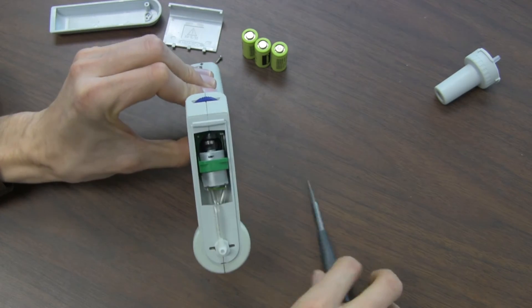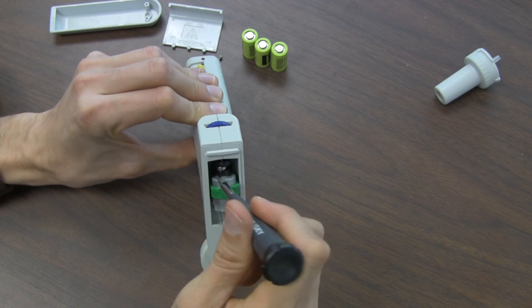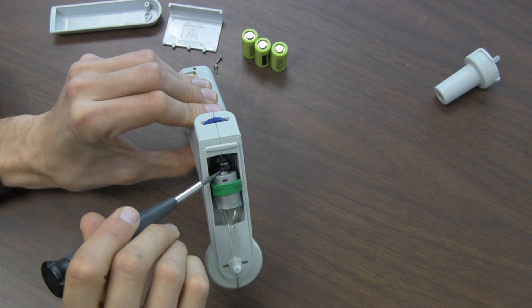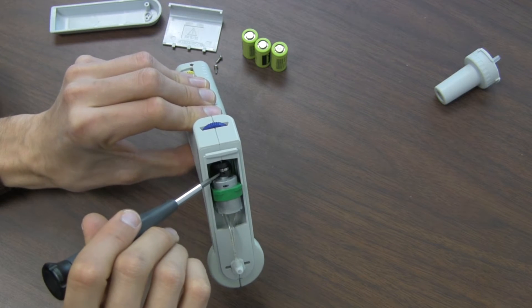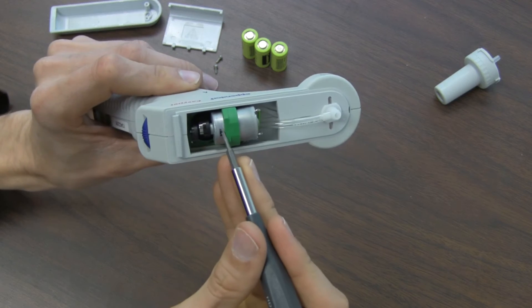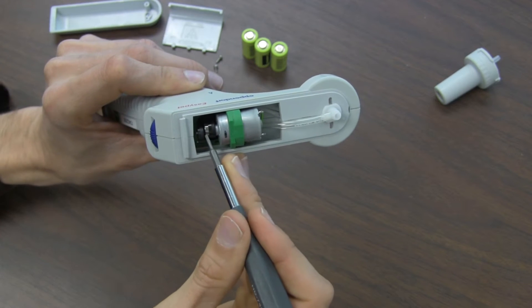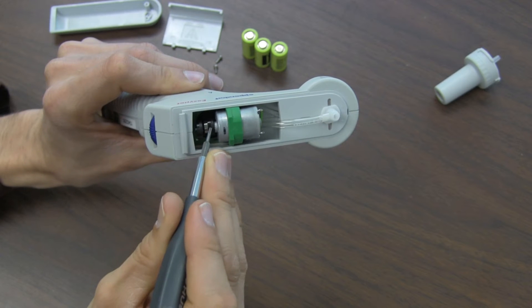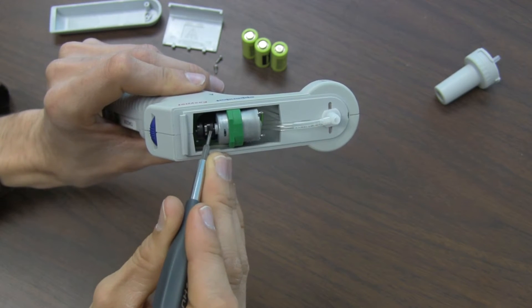Now you can see you can have a little bit of access to the motor. You can see how this piece of the piston rod of the pump is not fully seated on the bearing. This is the bearing here and this is the piston rod. And it's loose, it's just moving around.